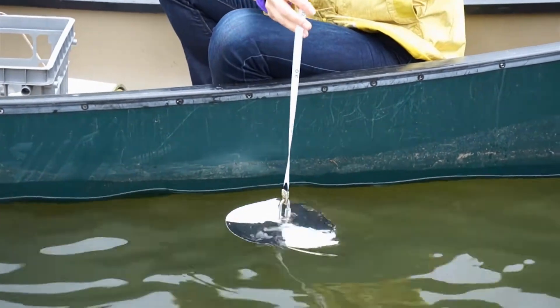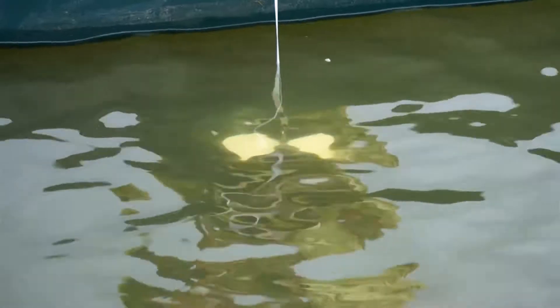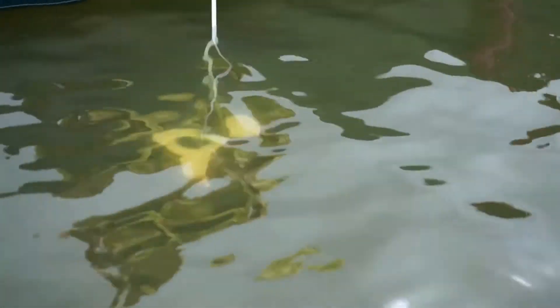If you're wearing polarized glasses, you want to take those off to make sure they don't create extremely high water clarity measurements that might not be consistent from one person to another, since most people don't use polarized lenses.